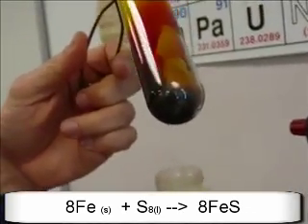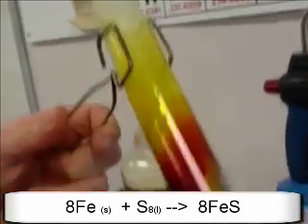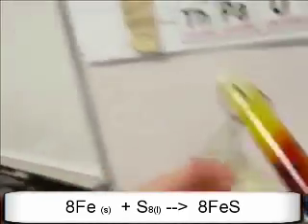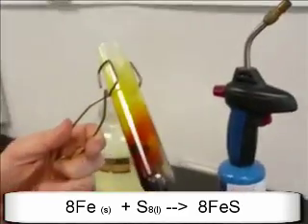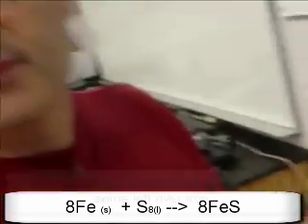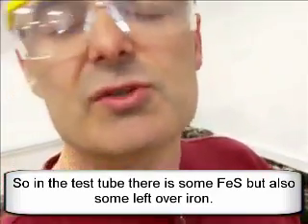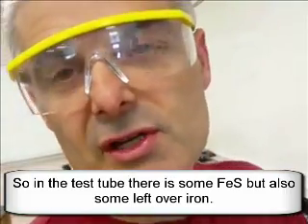If I take the magnet, now that the iron has reacted, it is no longer going to be attracted to the magnet. As you can see, there's some that's attracted to the magnet, probably because I didn't put enough sulfur in the reaction. If I were to truly cause this to totally react, it would not be attracted to the magnet at all, because I think I put too much iron in there. You'd have to figure out how much you'd want to add. But let's assume that I did. It would be unattracted to the magnet, which means you have produced something else, in this case iron sulfide, as opposed to just iron and sulfur.